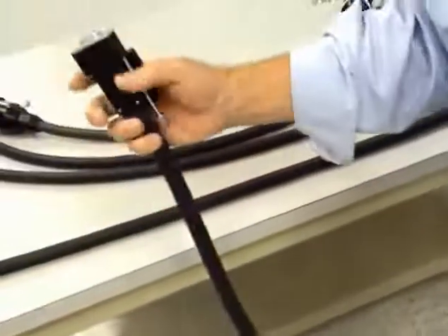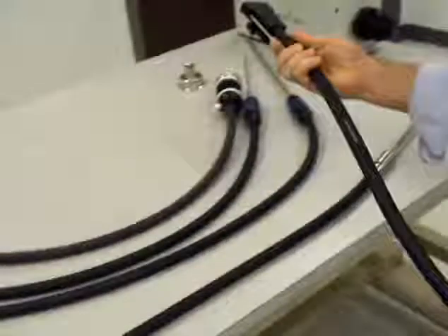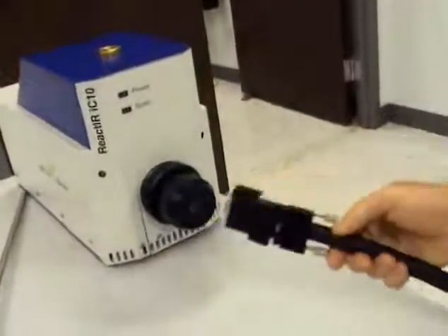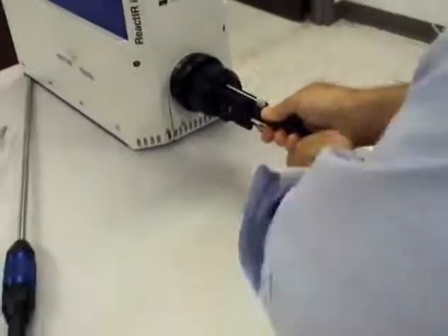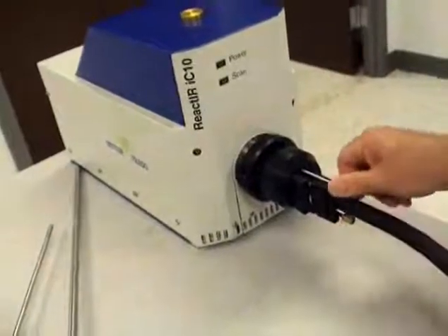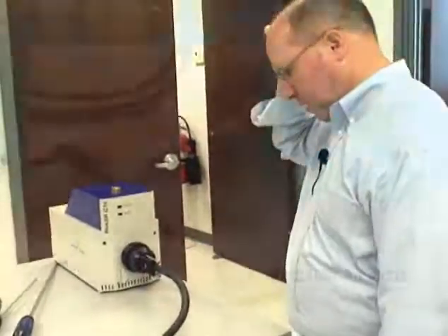The way that this connects is very similar to the way a PC cable connects to an instrument. We have a diagram here — it basically tells you that the little push pins need to be to the left. It can only go in one way because it has a D shape — that's the D of the DS — and essentially it just plugs in and you screw it in to connect it. And that's it, it's connected. It's pre-aligned, so there's no alignment necessary.